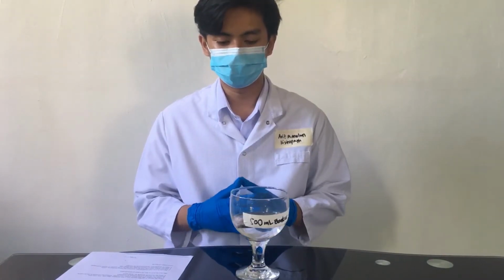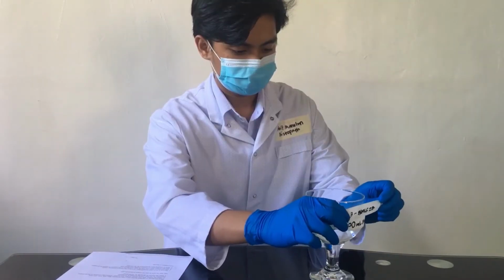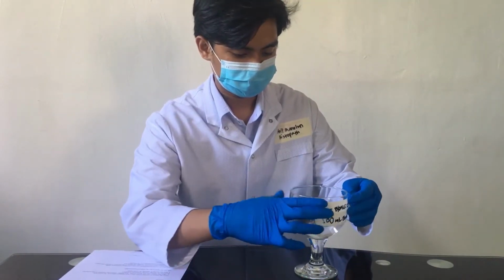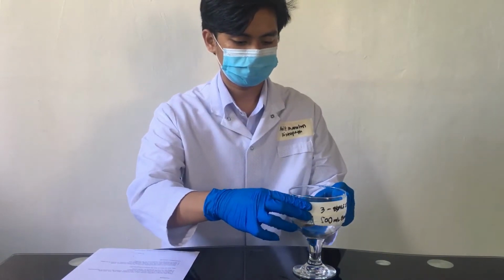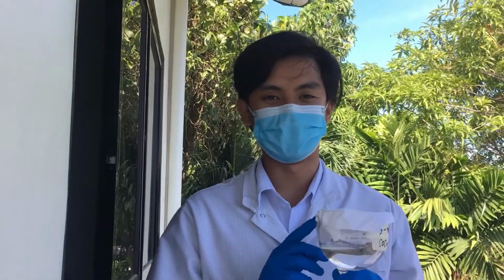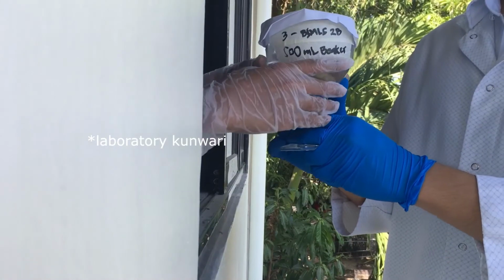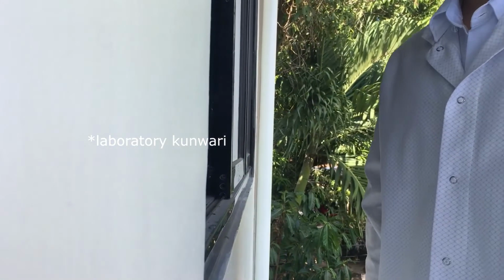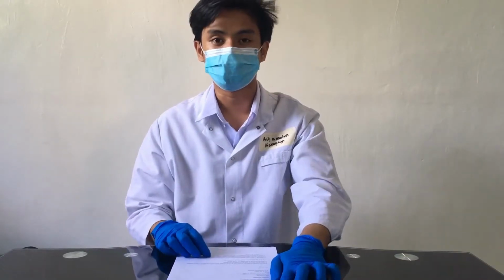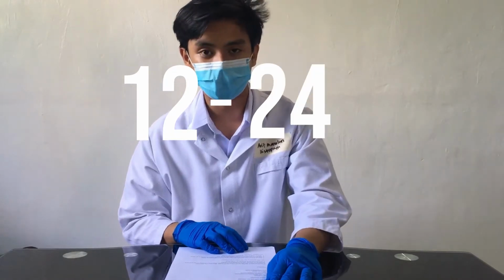Second, we have to label our beaker with our group number and section. Make sure not to forget sealing the beaker using the foil. And now we have to present the container to the laboratory stockroom for storage until the process is completed. While in the stockroom, we would allow the tissue to decalcify for 12 to 24 hours.